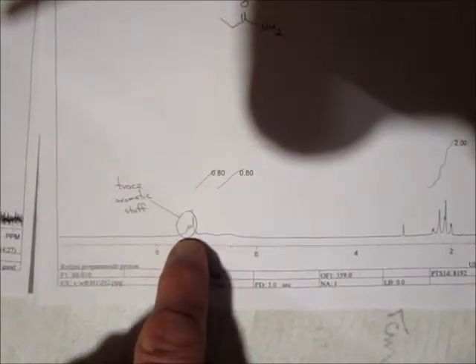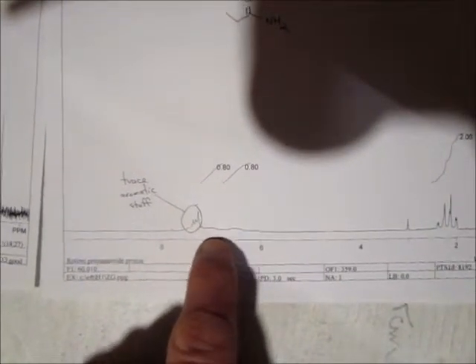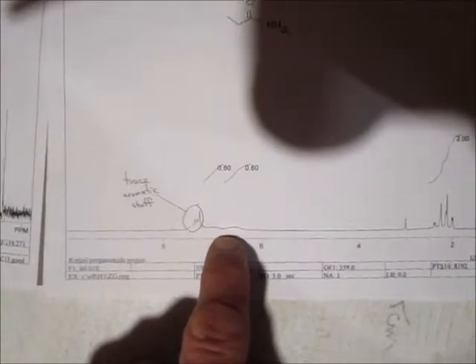The new compound, and this is the students that we ran this year, and you're going to see there was a little bit of trace leftover aromatic stuff, probably dirty in the NMR tube, but this compound is going to have a quartet and a triplet, so you can see that right here, quartet, triplet. And then right here, you can kind of make it out. There's almost like 2 bumps. Those are the 2 separate H's on the NH2 group. And that does happen. Sometimes you see 1 blob, sometimes you see the 2 of them kind of separate, each worth 1 hydrogen. So that's the proton.